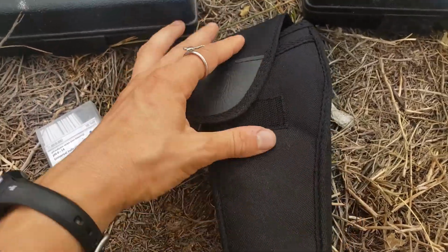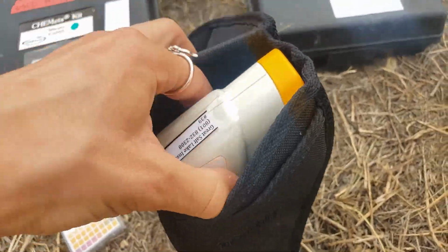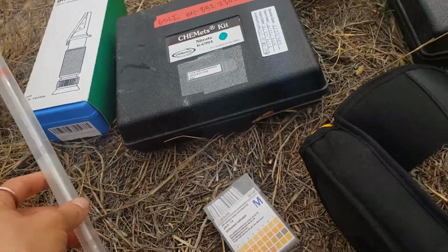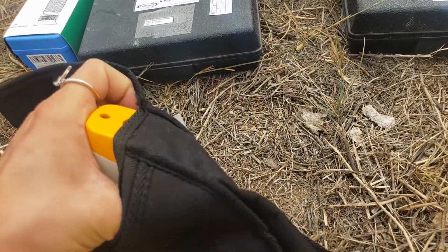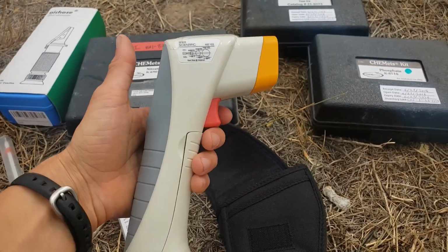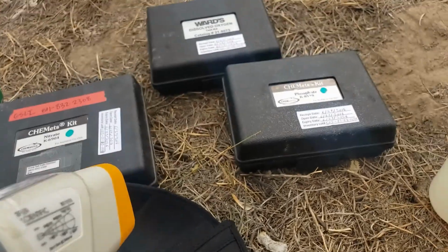First, let's just start with temperature. This is maybe one of the easiest things that you can measure if you don't have all these fancy tools. So you might use a thermometer to measure that. But if you do have fancy tools, this is one of my favorite fancy tools, which is a temperature gun. Okay, so this, you just don't shoot it in people's eyes, right?